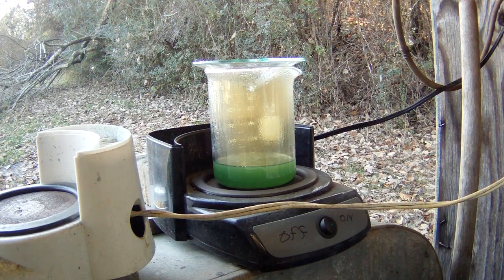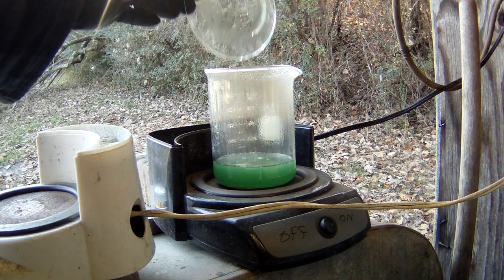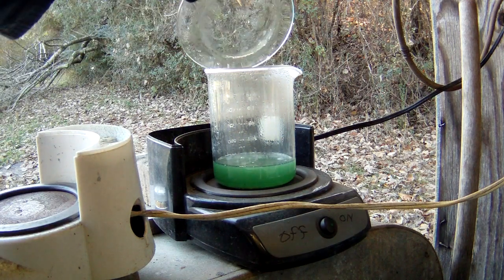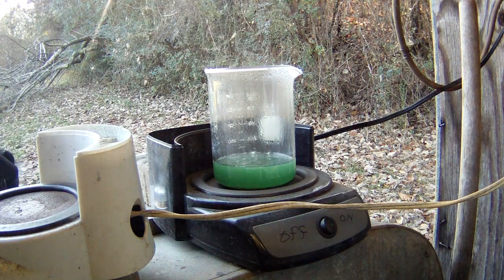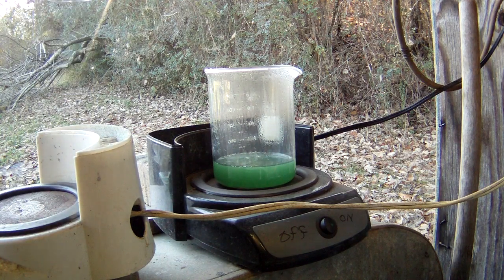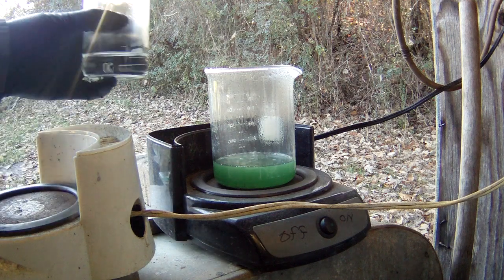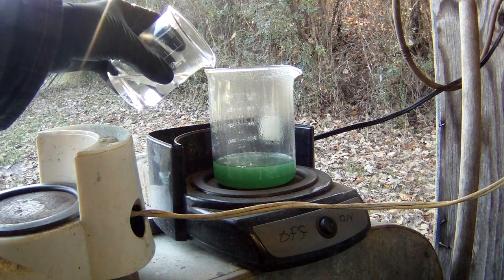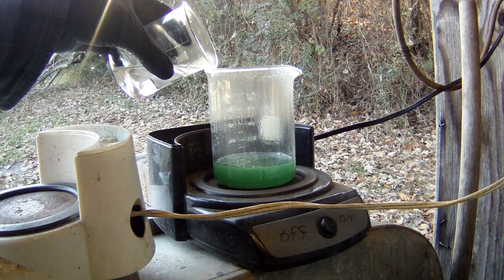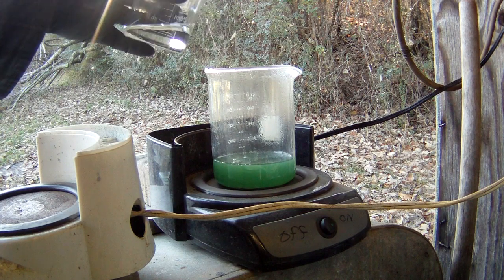Okay guys, well, we're about 15-20 minutes into this reaction. It's going pretty good. It's slowed down a little bit. So what I am going to go ahead and do is take this off and add us a touch more of nitric acid. Probably, let's say about another 20 mils or so. And this is hot, so now when it's hot, it's time for it to really be careful because this stuff could just blow right out of this container if you put too much in at one time.